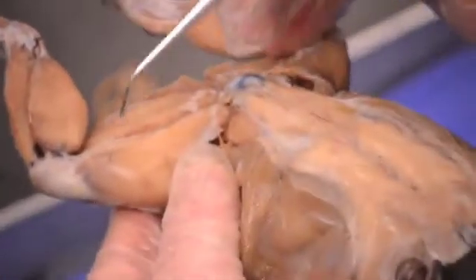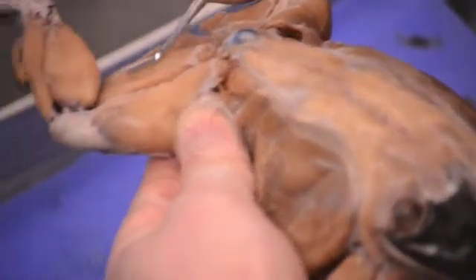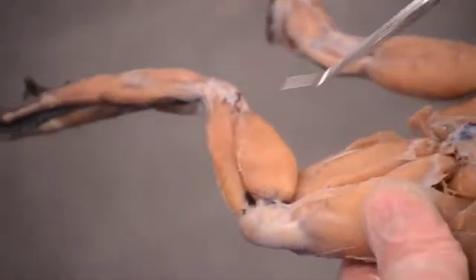After the vastus externus, this big muscle on the dorsal side is the semimembranosus — one of the hamstring muscles. The muscle on the very bottom, usually hanging off the bottom of the leg, is the gracilis minor. Moving to the lower leg, the big calf muscle is the gastrocnemius. The muscle in the front of the lower leg on the dorsal side is called the peroneus.